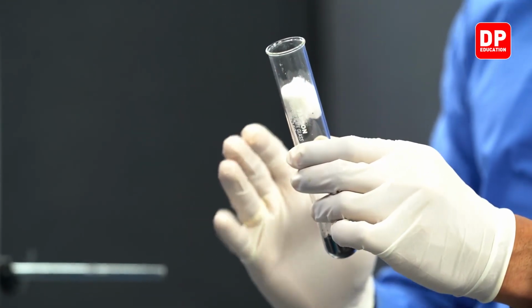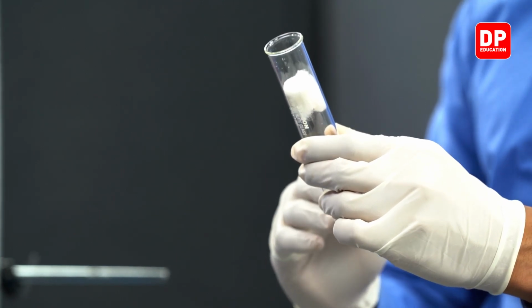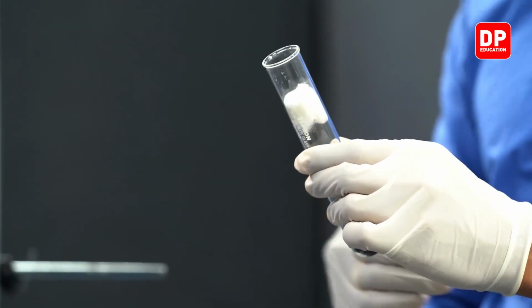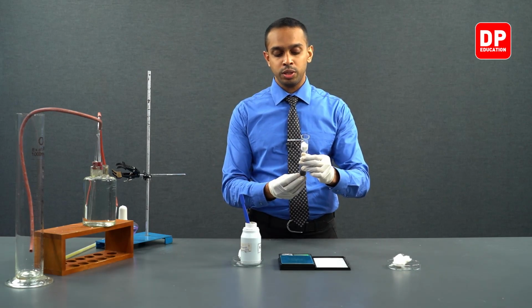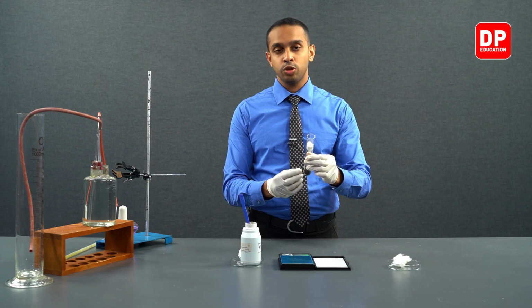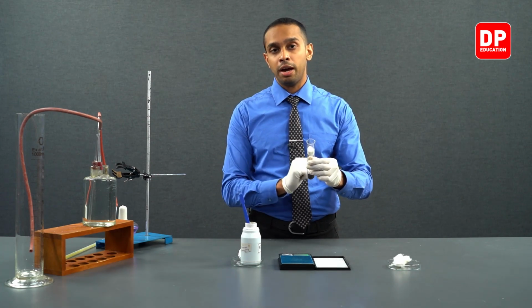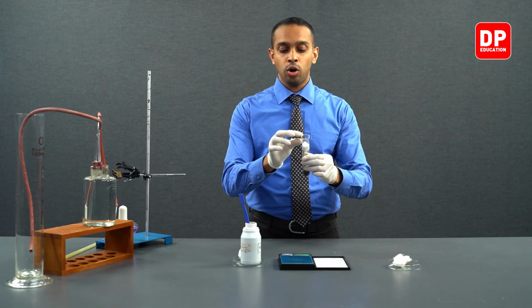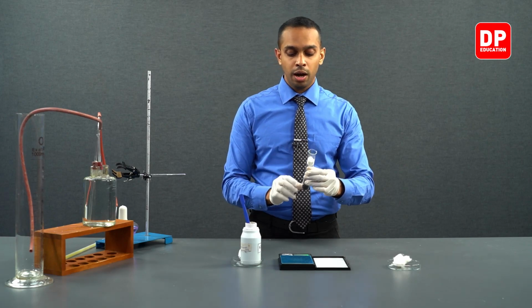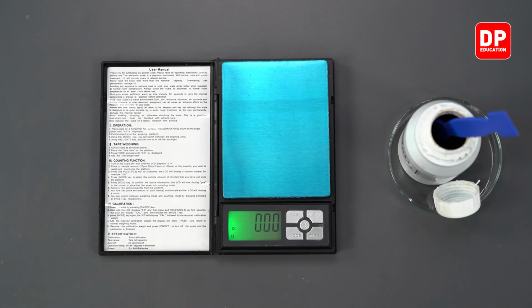This will act as a filter, entrapping any solid particles that may try to move on to the next part of our setup. Due to the heat that is produced here, sometimes certain solid particles can get carried away into the next part of the setup if we do not have this cotton wool piece lodged on the upper end of our boiling tube. Now, after doing so, we need to again measure the entire mass of this boiling tube.